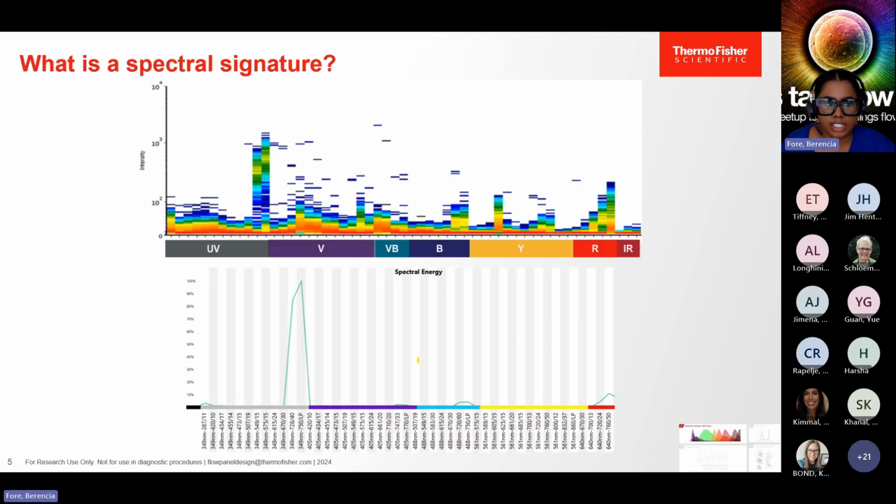So what exactly is a spectral signature? At the top of this slide, we have a BUV737, and we're looking at a signature in a little bit more detail. So first, when you're looking at this, you can think of it like a histogram turned on its side. The y-axis here represents the intensity of fluorescence ranging from 0 to 10 to the 4 on this type of scale. And in this example, we can see that the fluorescence intensity is increased in the last two detectors in the UV region. So as I said, this is the signature for BUV737. It makes sense, as the range for detection begins in the 300 nanometer range and ends in the 800 nanometer range. And so we have that 737 represented here.